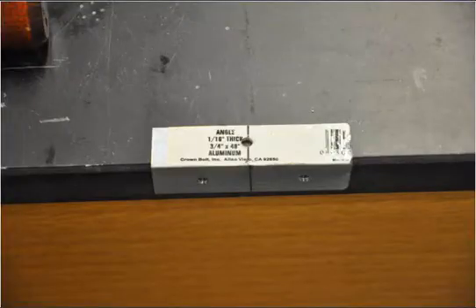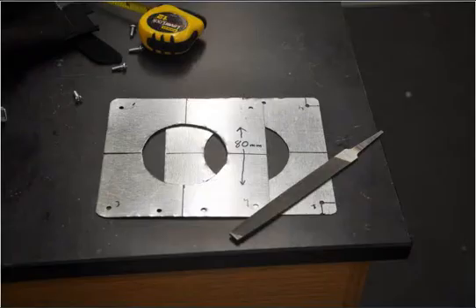After we drill those holes, I'm drilling a 1/4-inch hole in the other side of the mounting bracket so that it can fit on a test stand or a ring stand, if you will, even though it doesn't have a ring on it.